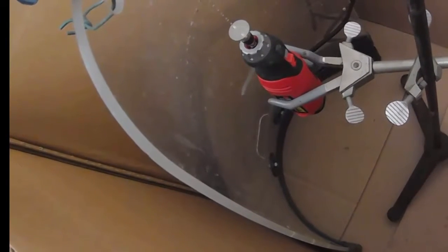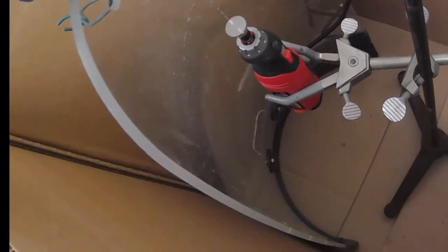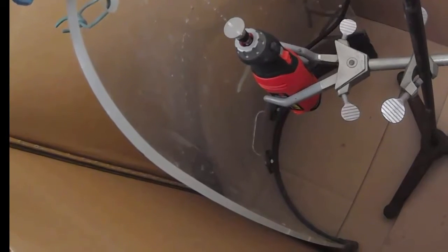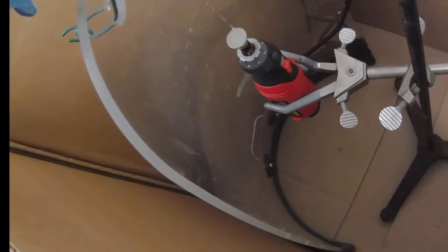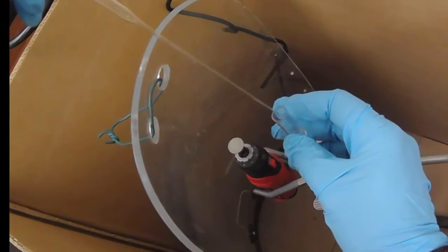As you can see the liquid spreads out quickly so that we get even evaporation and more even coating of the surface as opposed to other methods of casting a film of the polymer.